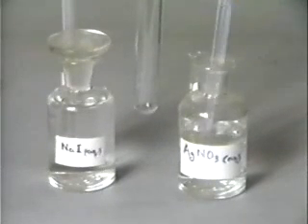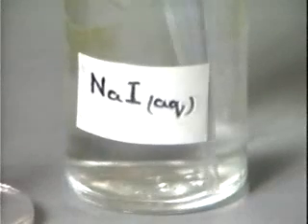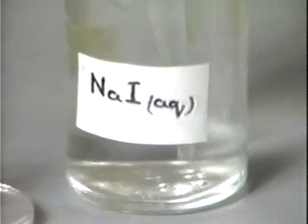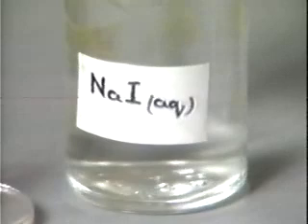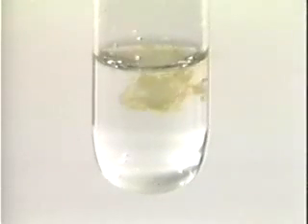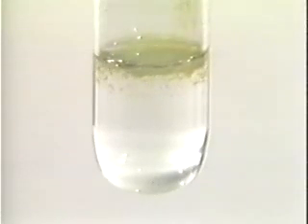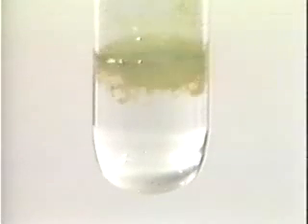Again we take aqueous silver nitrate. This time we are going to add aqueous sodium iodide. When the sodium iodide is added to the silver nitrate, we get a pale yellow precipitate of silver iodide.